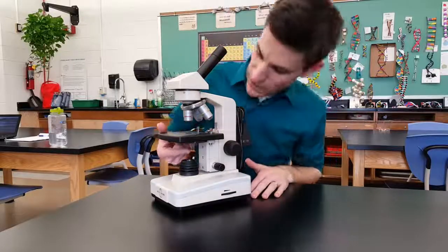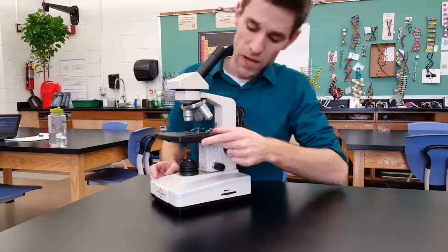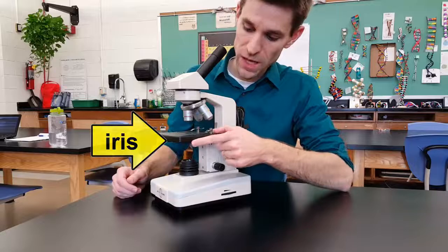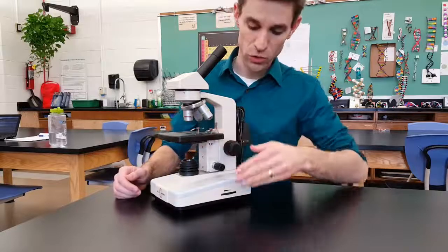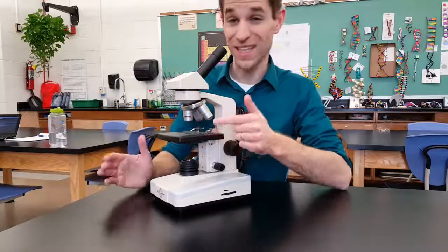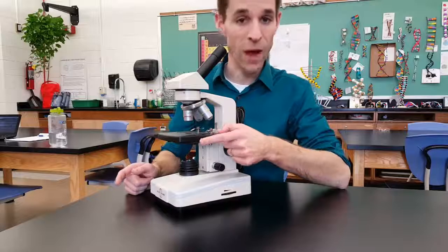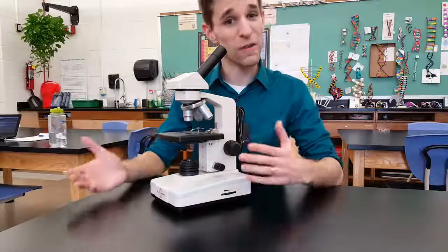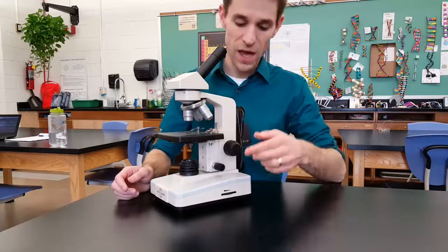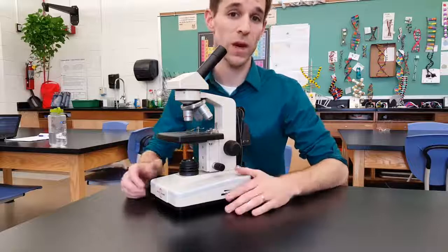There's actually a small lens right here in the stage which helps focus the light a little bit. Also right here on the stage is another knob called the iris — this is another way to change how the light comes into your specimen and to control the amount of light. So you control the intensity of the light with the knob down on the base of the microscope, but you can control the amount of light with the iris, which is a little bit different. Every specimen is going to require a unique combination of magnification, iris adjustment for the amount of light, and the light adjustment for intensity, in order to see your specimen in the best way possible.